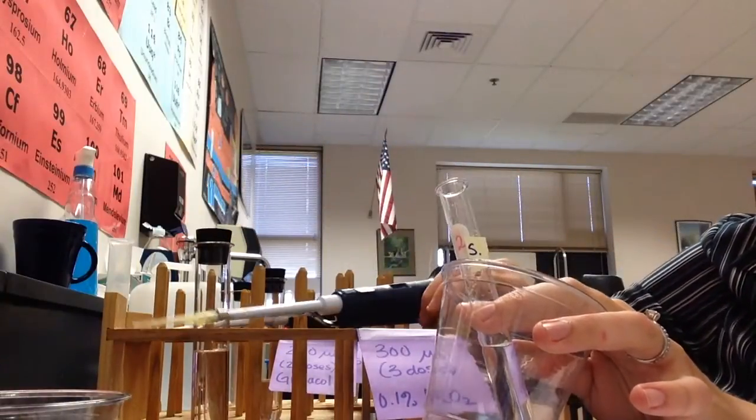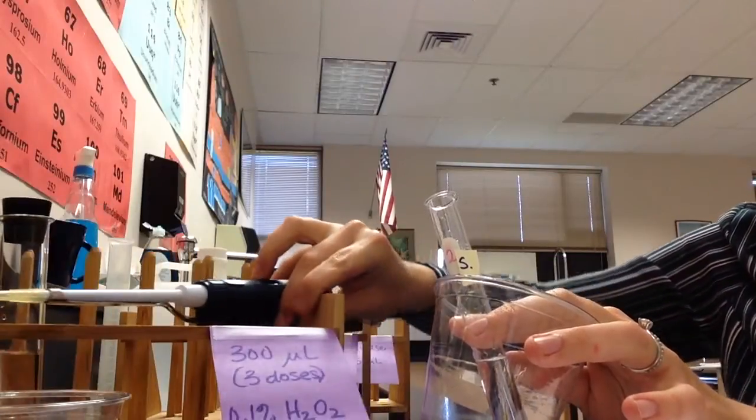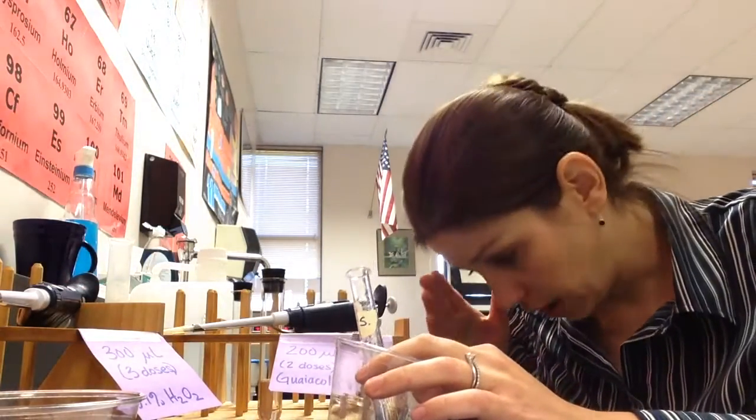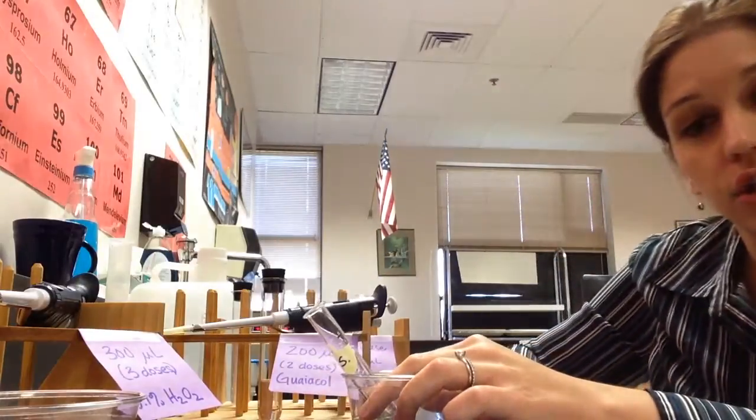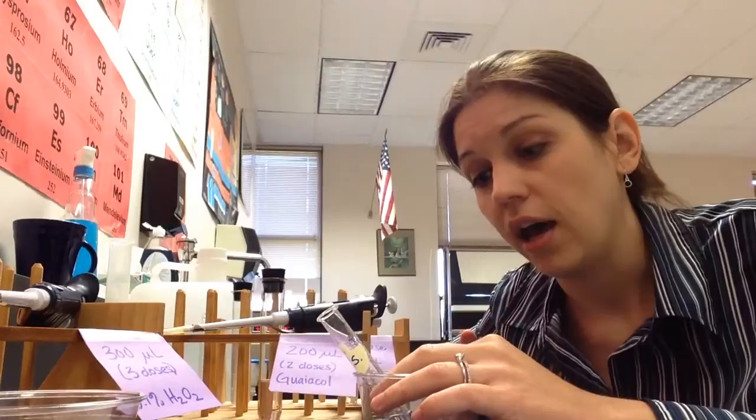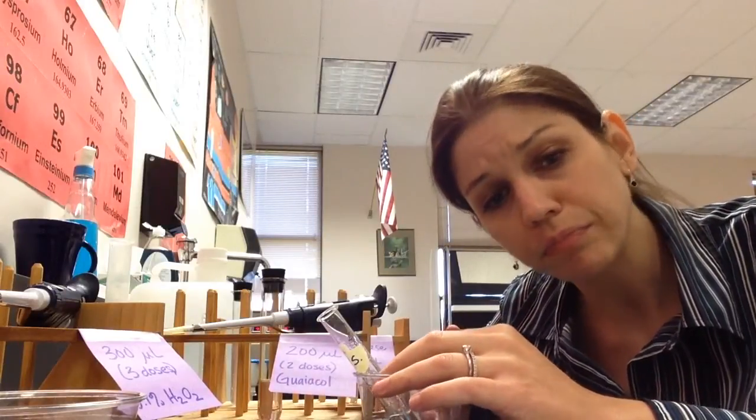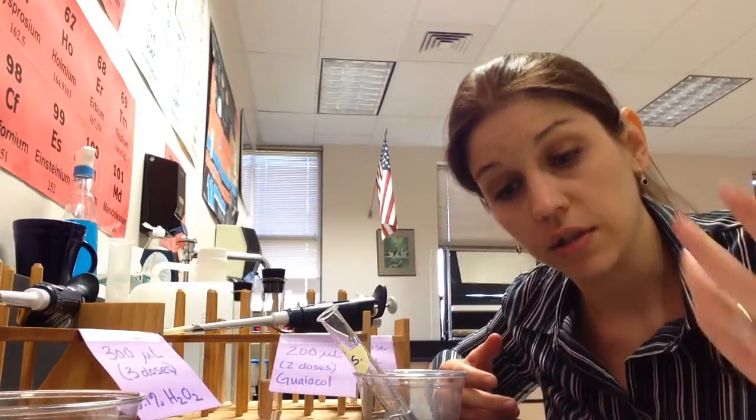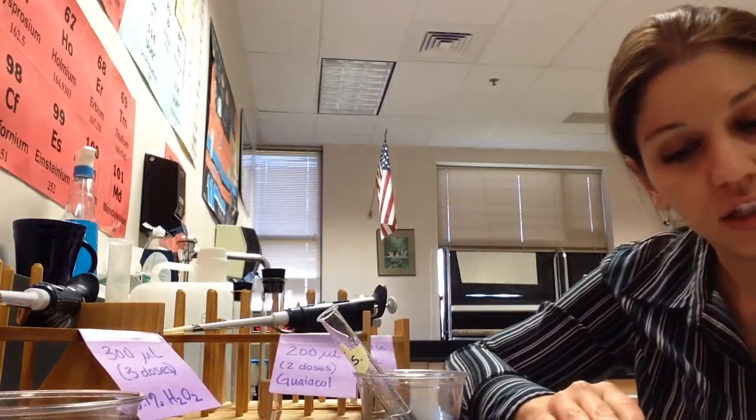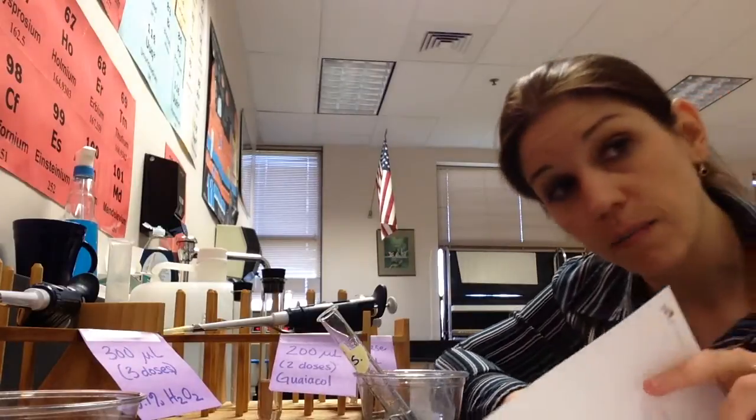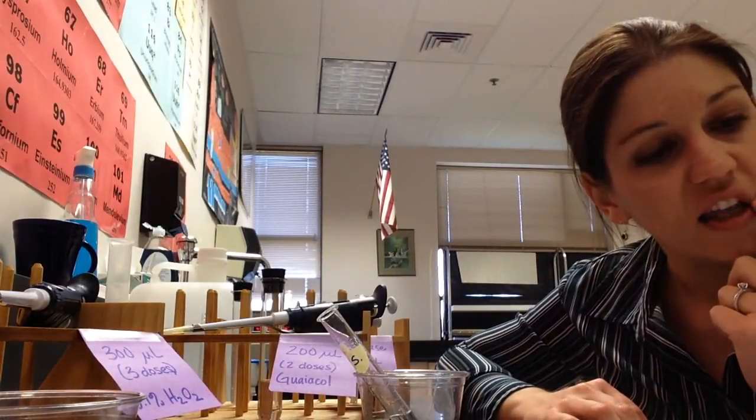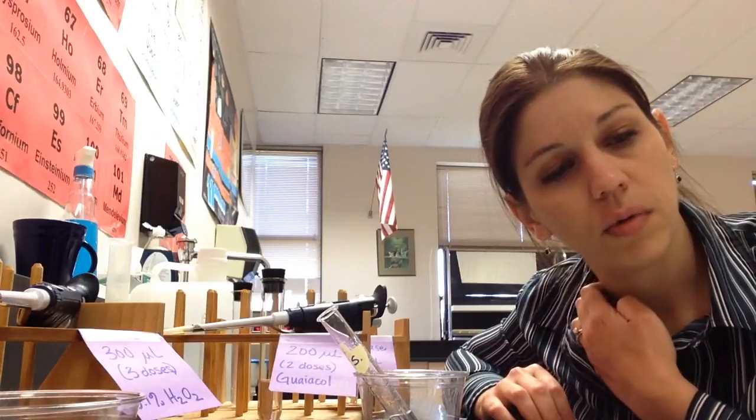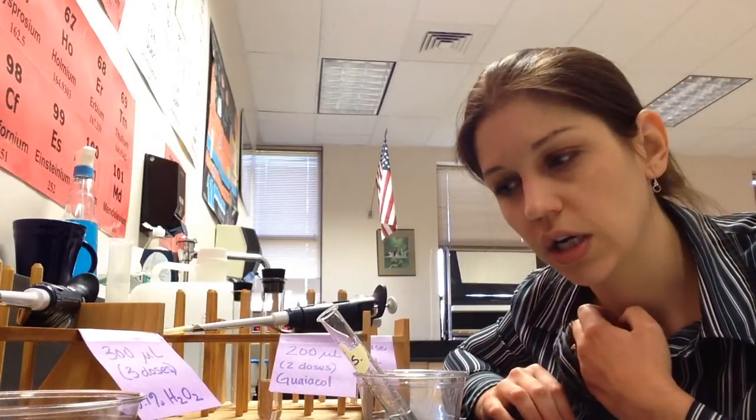At this point, we are ready. Now, there's only going to be five spectrophotometers around the room. And so you don't want to start your reaction until you and your group has literally claimed one of them and you're standing in front of it. Because you are going to keep record for five minutes of how these numbers are changing over time. And so if you looked at step four in your lab notebook, it said to record the color, which is the absorbance, at one minute increments. I do think that we can probably do better than that because we have the spectrophotometer. And so I think that you're probably best to do it in 30 second increments rather than in one minute increments. It's just going to give you more points to plot. And I think that that will be useful. So you're going to collect data in 30 second increments.